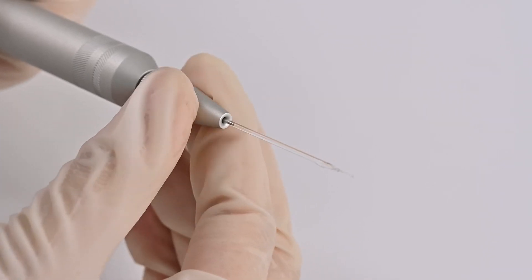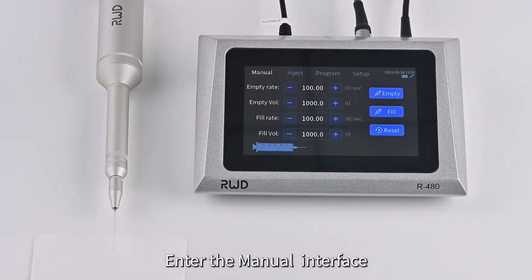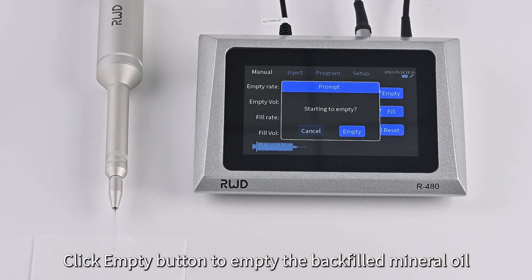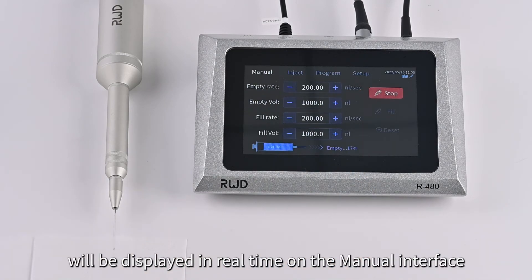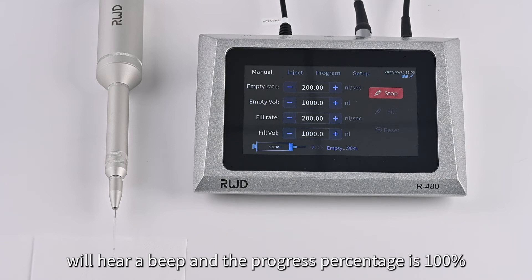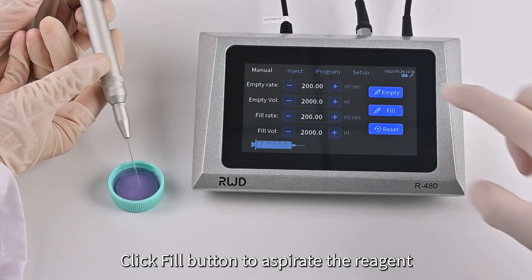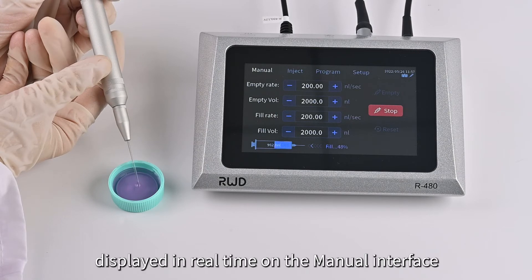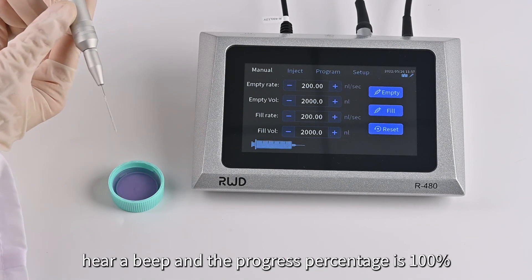Tighten the collet. Enter the manual interface, set the target empty rate and volume, and click the Empty button to empty the backfilled mineral oil in the electrode to the target volume at the set empty rate. During the emptying process, the progress will be displayed in real-time. After emptying is completed, a beep will be heard and the progress percentage will show 100%. Set the target fill rate and volume, then click the Fill button to aspirate the reagent. During filling, the progress is displayed in real-time. After filling is completed, a beep will be heard and the progress percentage will show 100%.